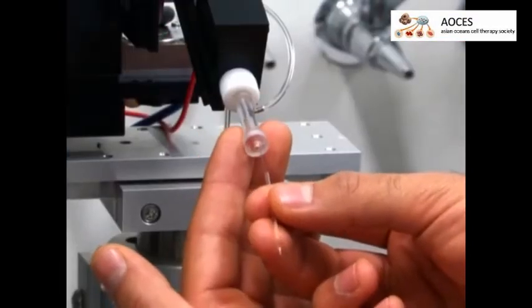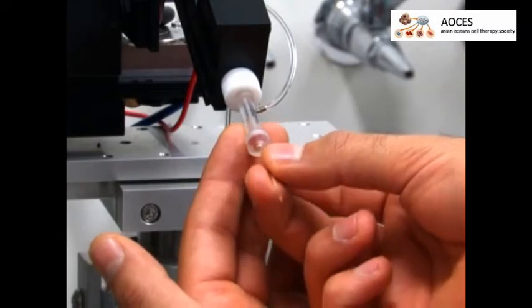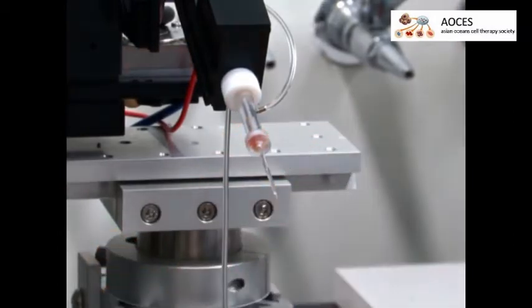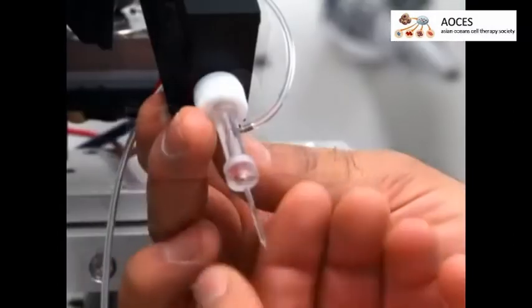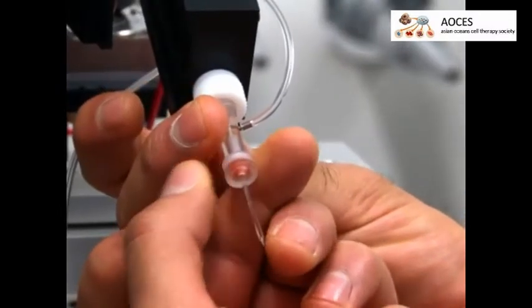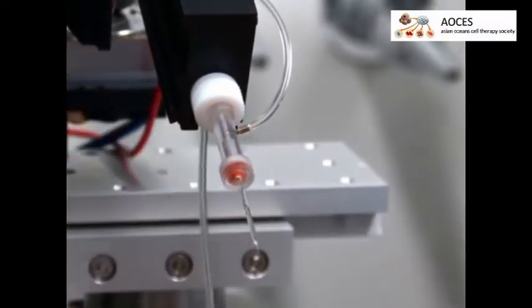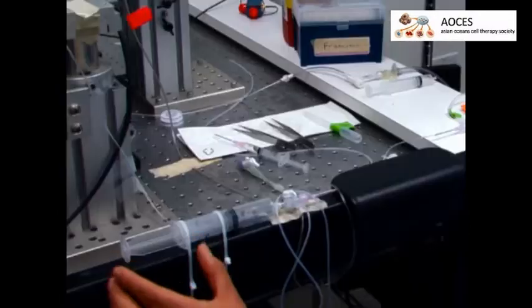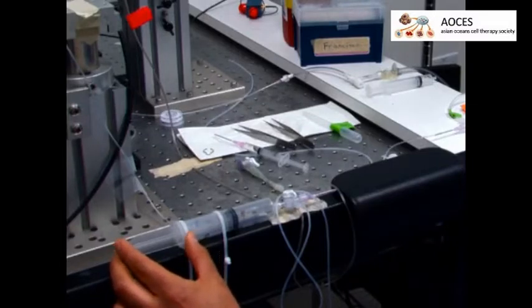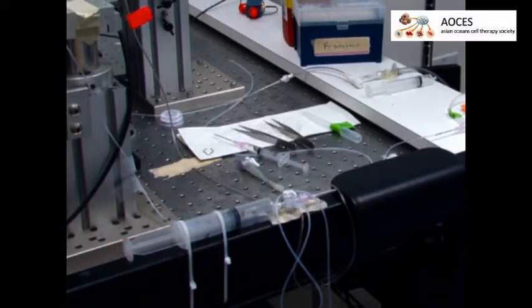Then, place the micropipette in an electrode holder so the solution comes in contact with the silver chloride-coated wire electrode. Tighten the pipette cap so that the cone washer forms a seal around the micropipette. Next, apply positive pressure with the air-filled syringe connected to the pipette holder before immersing the micropipette in the ACSF to prevent debris from entering it.